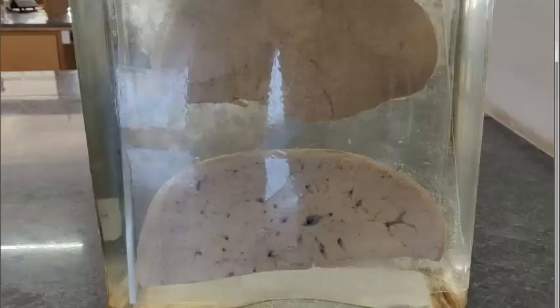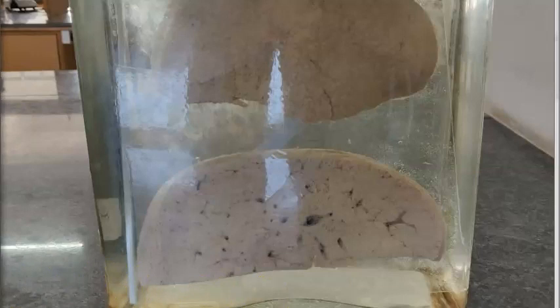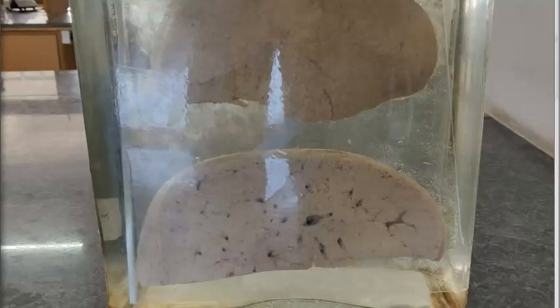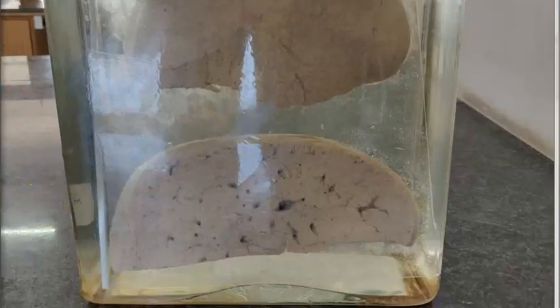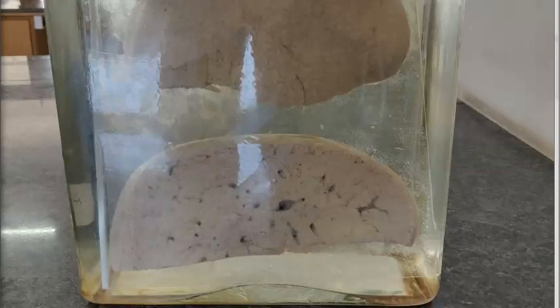Nutmeg liver is the same as CVC liver. Now cirrhosis of the liver — in the gross specimen you can see a large fatty liver with nodules less than 3 mm in diameter, so it is micronodular. The surface has a hobnail appearance. There are nodules with fibrous septa. Microscopically, there is loss of normal hepatocellular architecture, inability to spot the central vein, necrosis, fatty change, micronodules, and ductal proliferation.